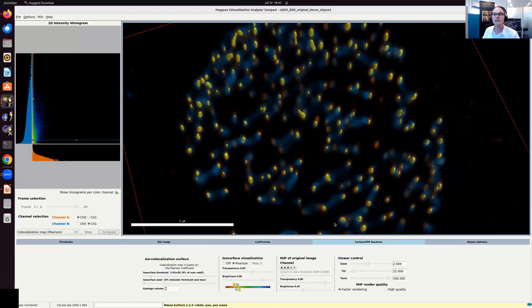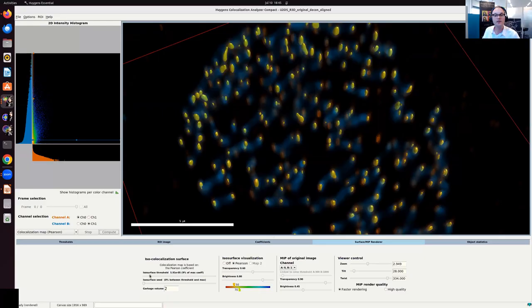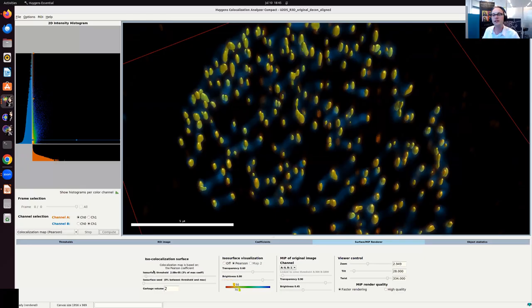Now you also see these little points appearing, and these are just a visualization aid where there are areas of high colocalization. And if I just change the threshold a little bit, then you see that these guys here in the background, they also start to appear.